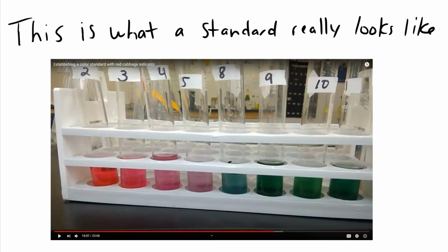In previous years we've done this very thing, and you can see the range there from, in this case, 2 to 11. Down on the acidic side around 1 and 2, you are red. And as you become higher in pH, so as you drift towards neutral, you go from a magenta to a pink to a purple to a darker purple. And then around neutral, you start to turn more into the bluish greens.